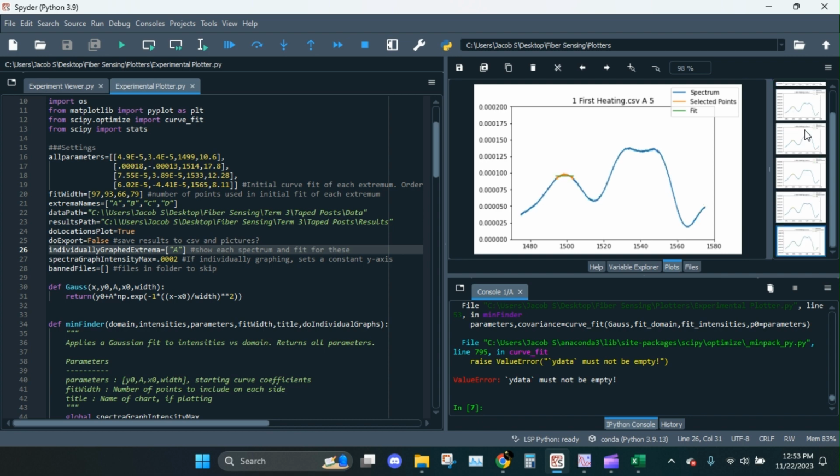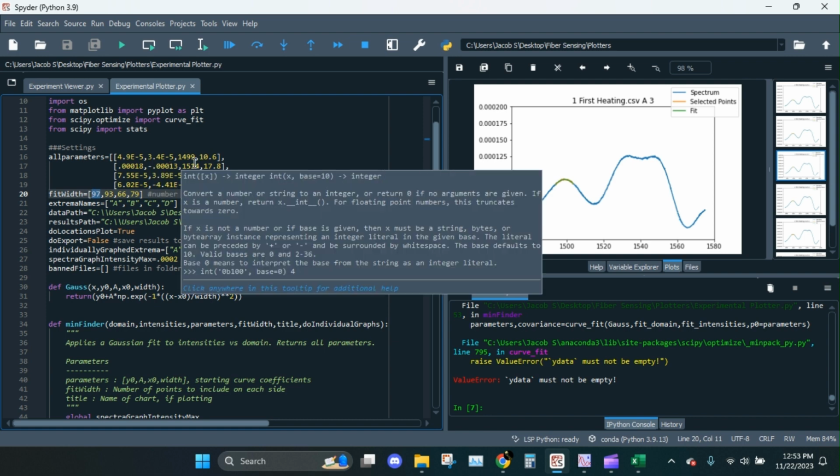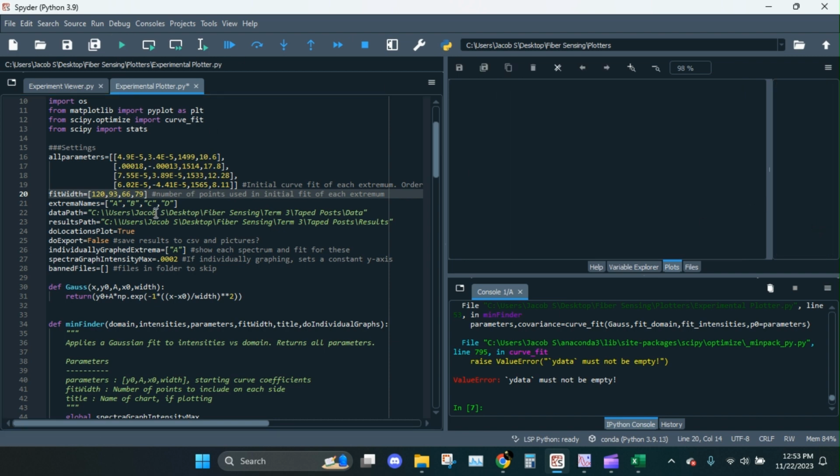I'm going to try upping the range bit on that one. So instead of grabbing 97, I'm going to say, I don't know, let's do 120. And the reason I'm guessing more is that I actually have a function where if the curve fit doesn't work at first, it's going to try to shrink the range. So if that didn't work, maybe increasing it will help. So let's try again.